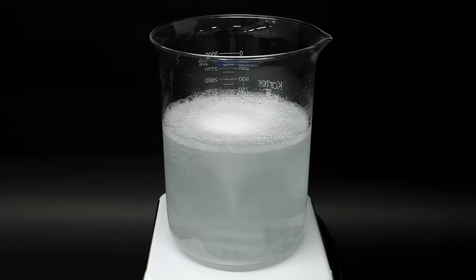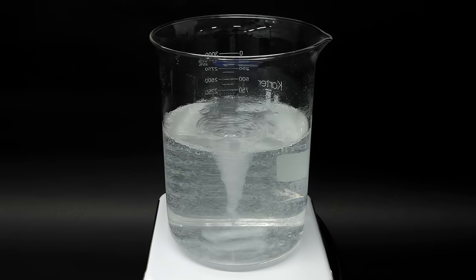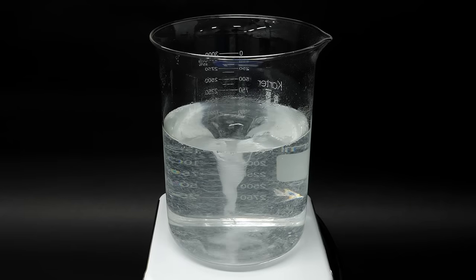What I'm trying to do now is get rid of pretty much all the water, and unfortunately, what I have is mostly water.